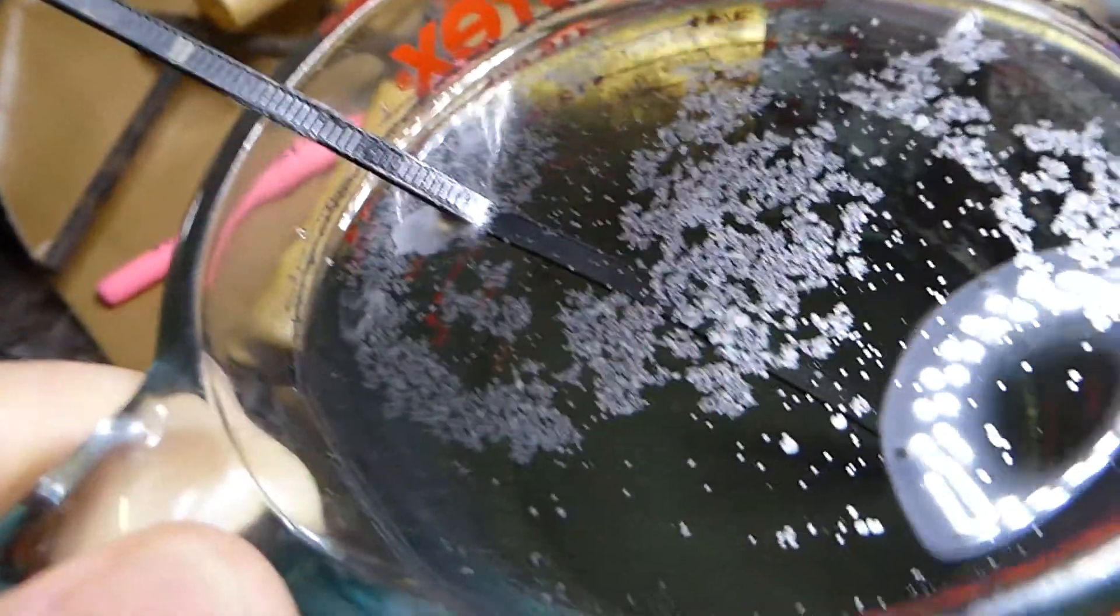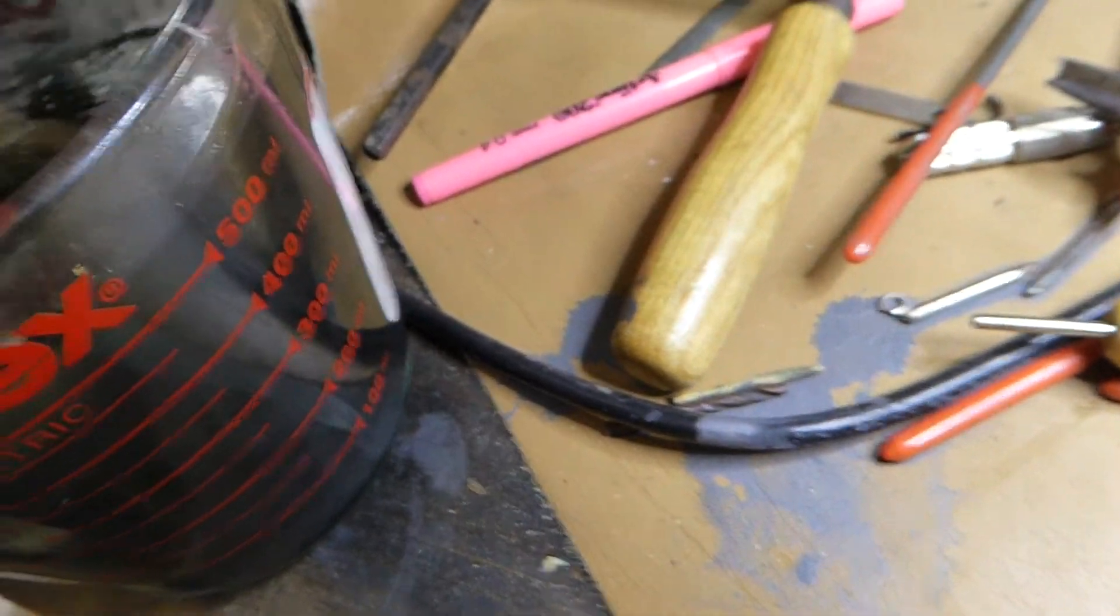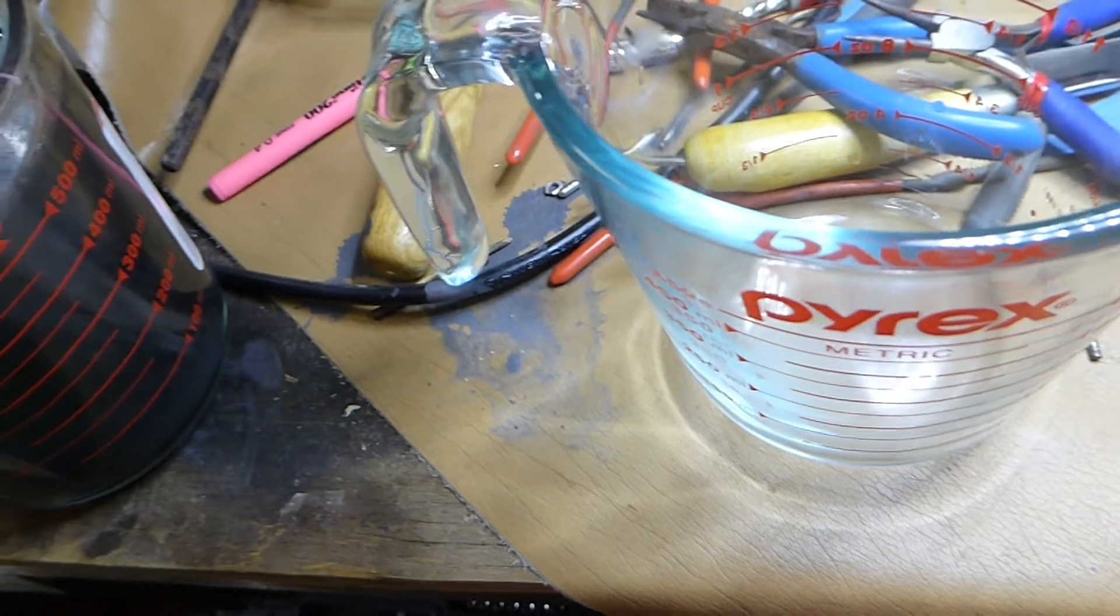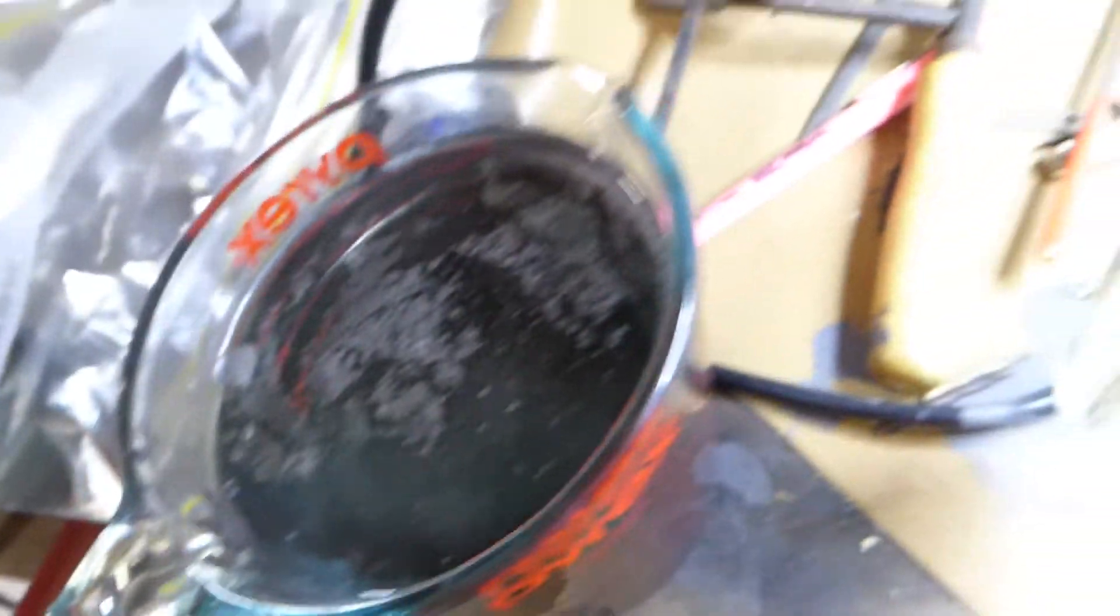So I'm just going to shuffle the jugs around and decant.